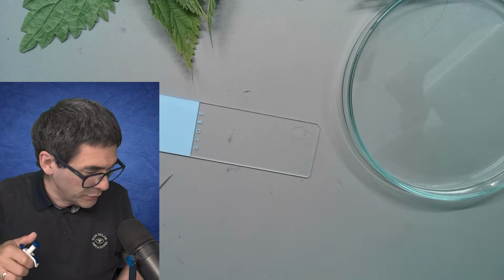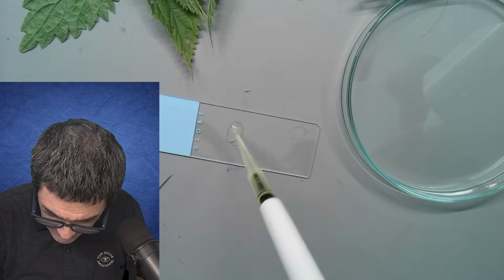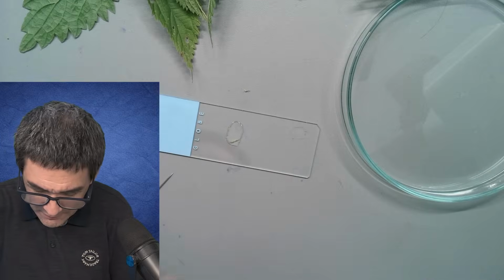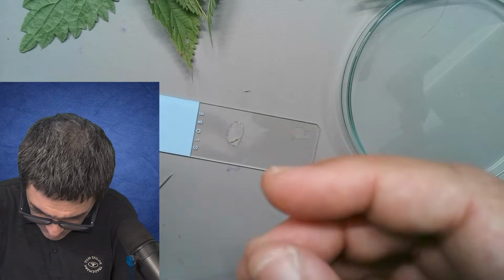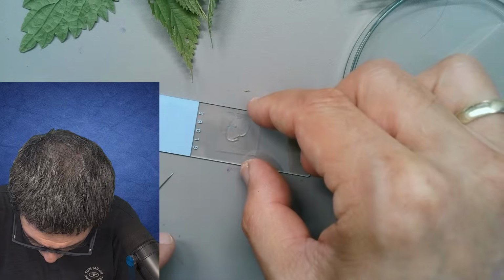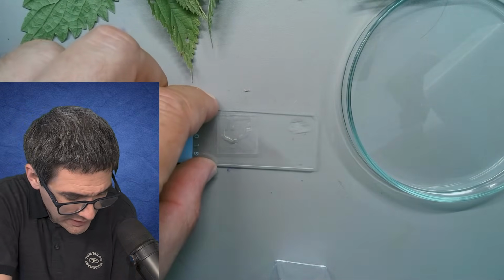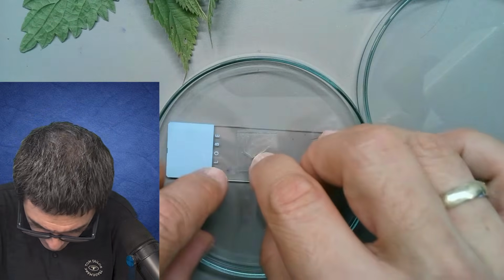I'm going to press down on it and compress it, and hope that this will make sure that it is sufficiently flat. So the cover glass goes on top here. You see, it is fairly thick. So I now need a solid thing here, and I'm going to simply press down on it now.